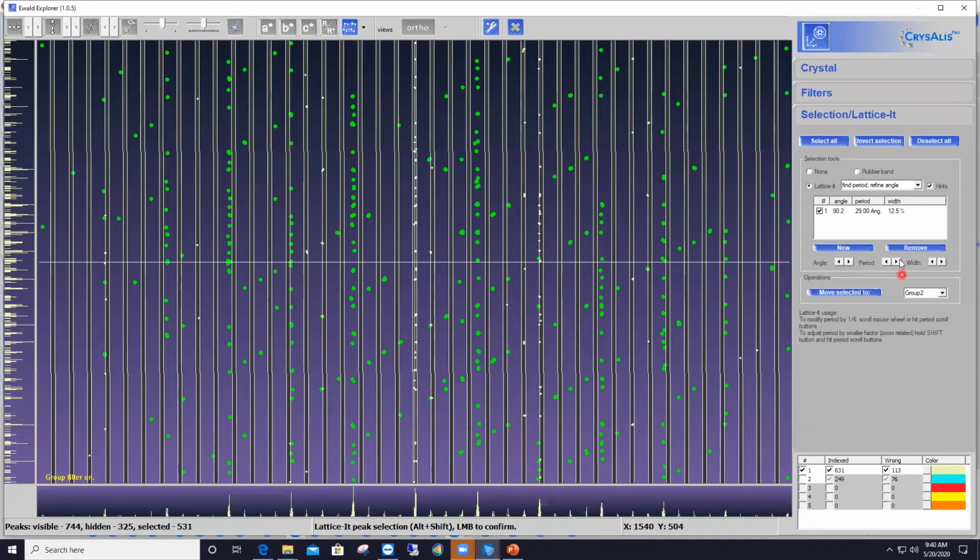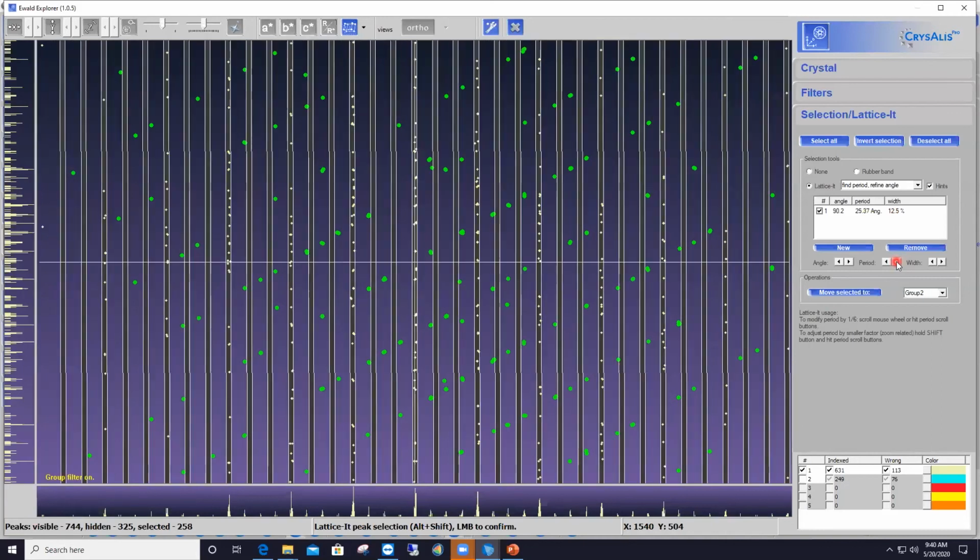Okay, so let me click on that button once more. And now you see that we've made progress already. That fully populated row is selected by a bar. This one also, and in between we have only two left and no longer three like before. So we are on the right path. I'm just going to keep clicking on that button.